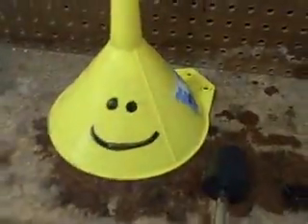Hey, Brandon. Hey, there you are. Okay, so we're doing experiment 3.7, the density of a gas. And today we're performing an experiment to find the density of a gas.